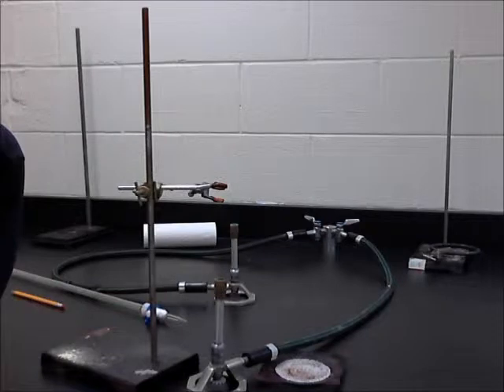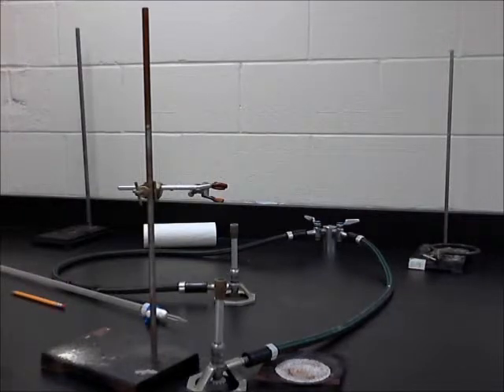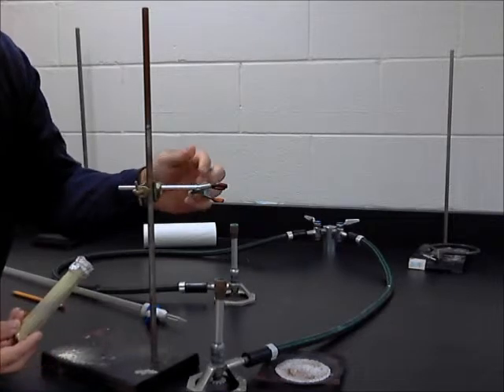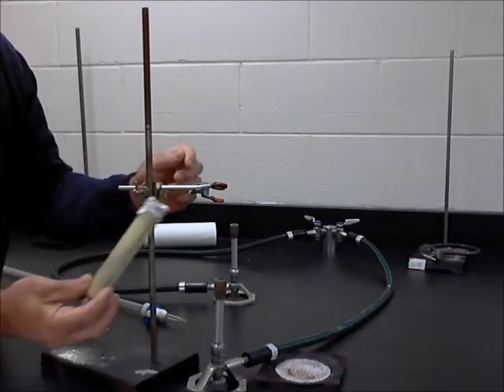Number 6 says put the test tube into the test tube clamp and secure the test tube clamp firmly to the ring stand. Tilt the test tube and aim the mouth of the test tube away from people and or common pathways. The clamp or any rubber part should be free of the flames. One of the important things about being in lab is being able to look at all these little screws and turn things to get this to work.